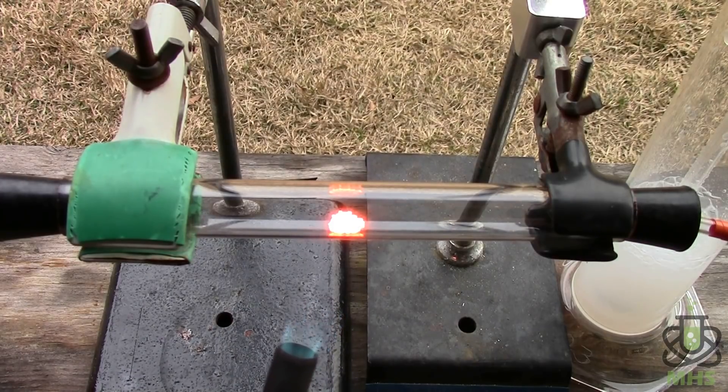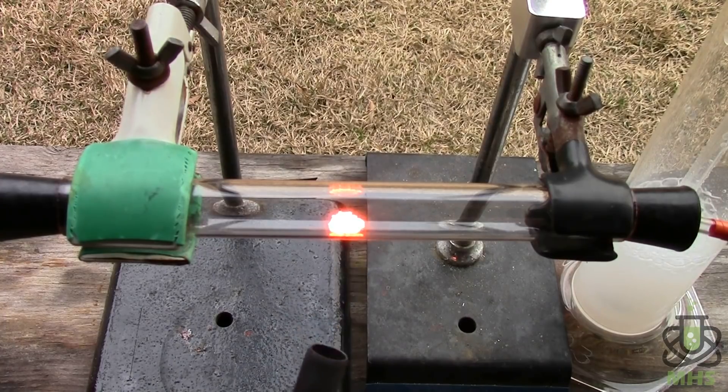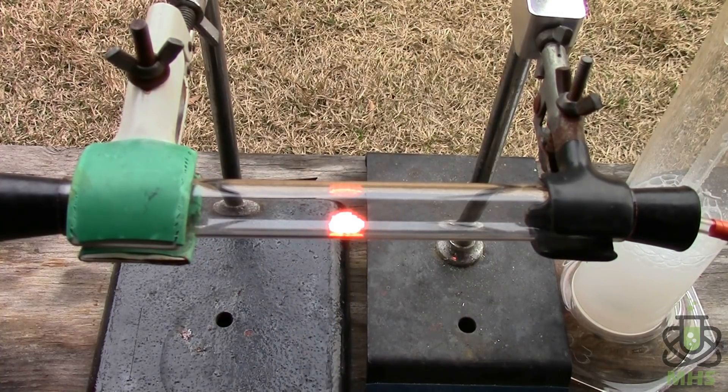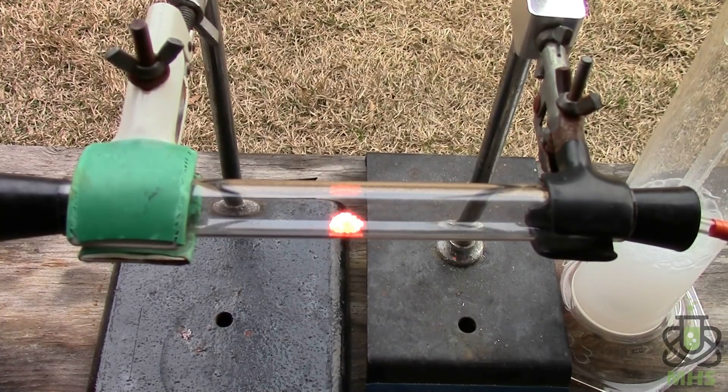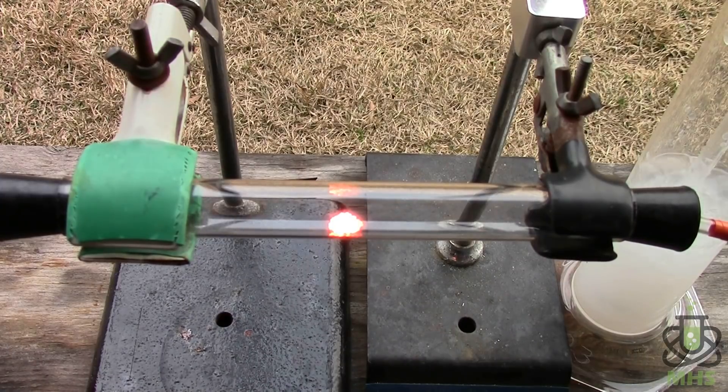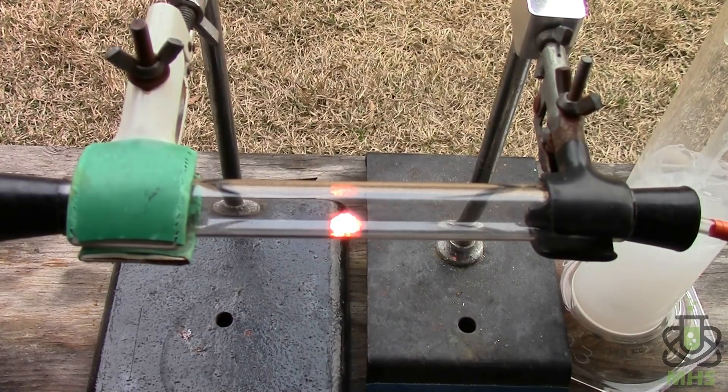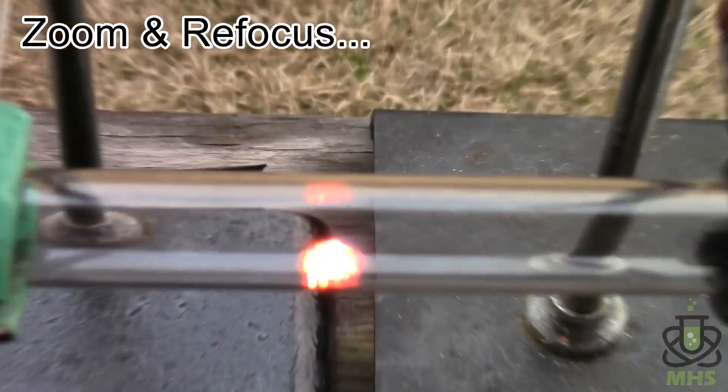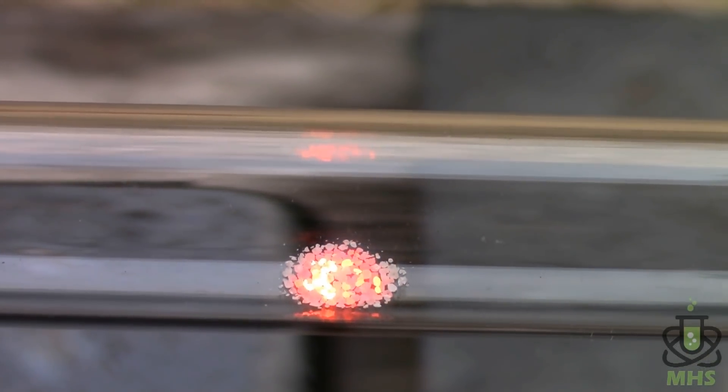Now what's really cool about this is if I remove the heat, watch what happens. They continue to burn. So I'm going to actually increase the oxygen flow a little bit and you see they brighten up a little as they continue to burn in the oxygen. There we go.